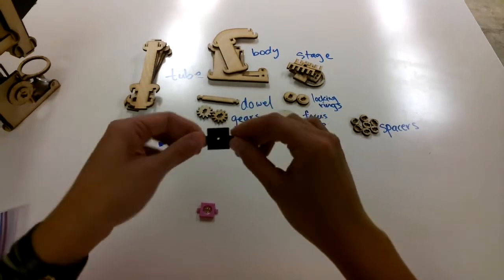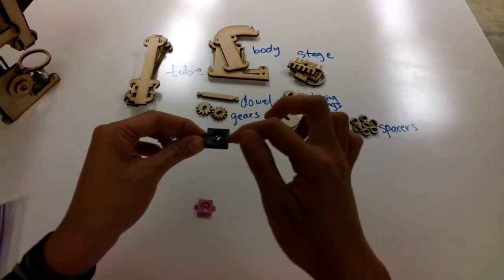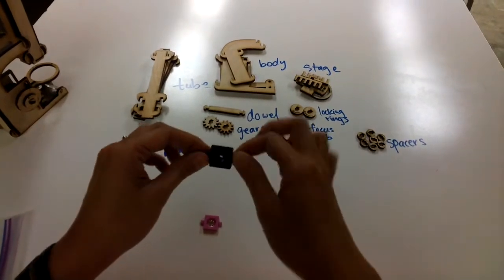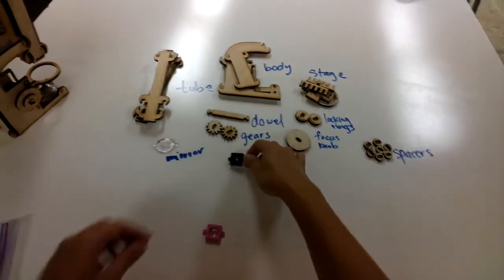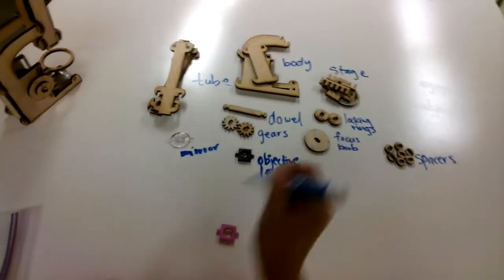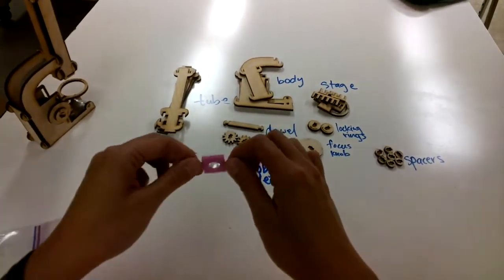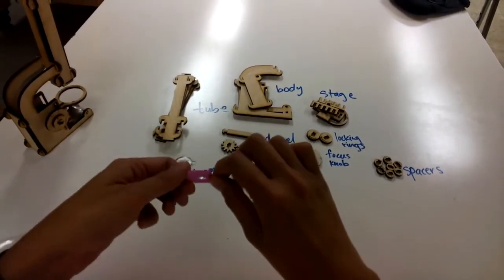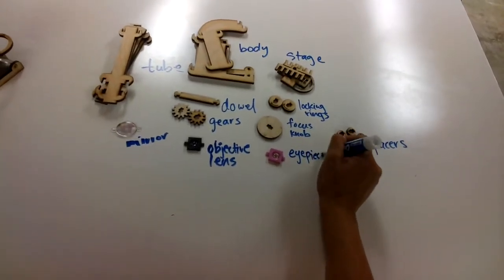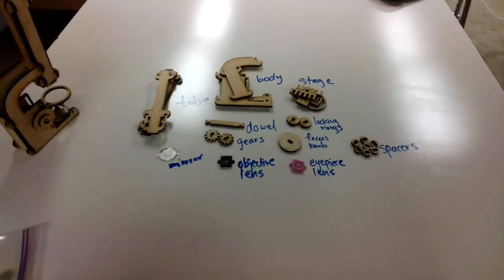One of them is basically the objective lens. And the way you tell that it's the objective lens is that on one side you have a big hole, and then on the other side you have a tiny little hole. So make sure that you get a lens that is like this, and this is your objective lens. And then you need the other lens. You need 2 lenses for your microscope. This one is the eyepiece lens. So it's different from the objective in that the holes on both sides are big. Okay, so you should have all of these parts of your microscope, and then you're ready to get started.